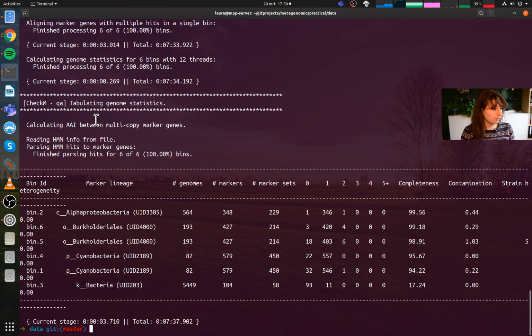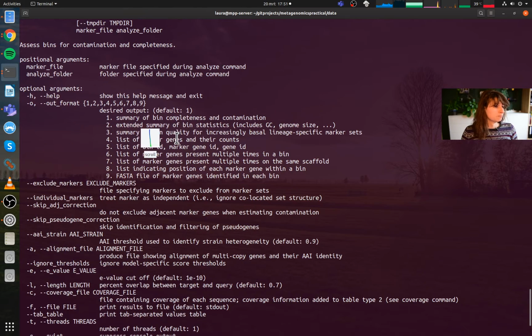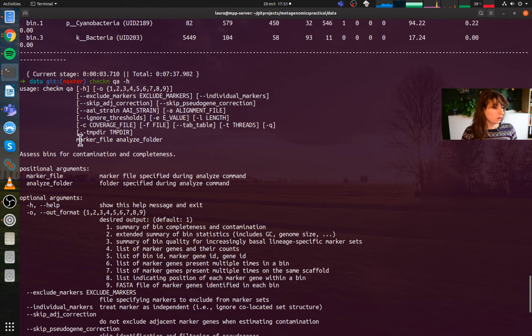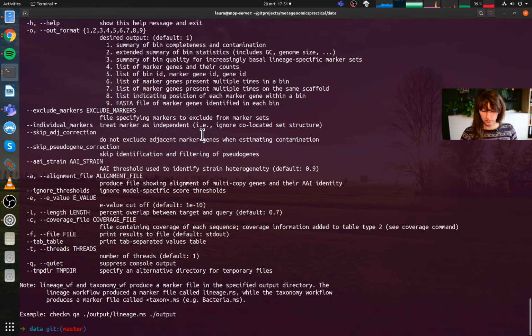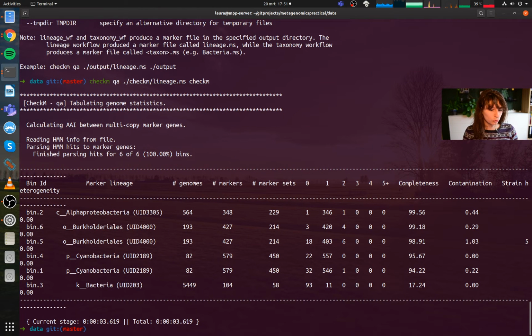So I'm going to make a nice file of this with QA. So it says up here, checkm qa. Let's see how that works. checkm qa, marker file, analyze folder. So I think that is something like this. Was it data/checkm? Oh no, we're already in the data folder. checkm lineage, and then just checkm. Easy as that. Should get us the same output. Let's double check. Cool. That's what we want.